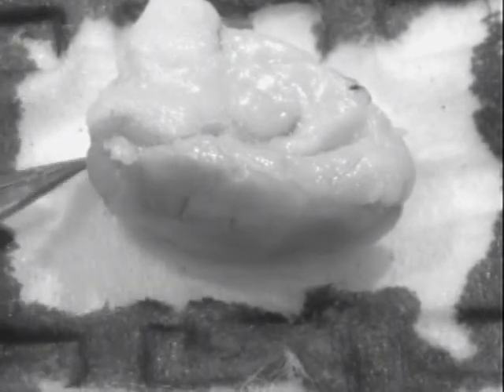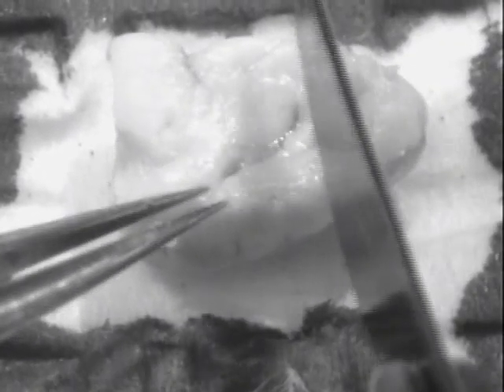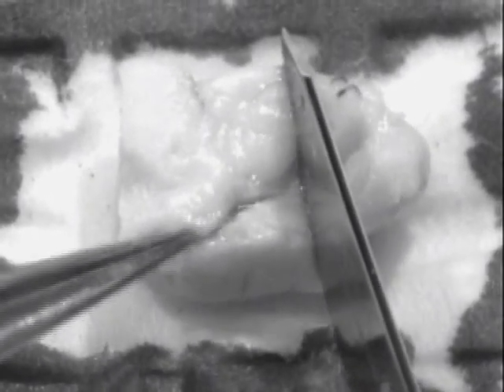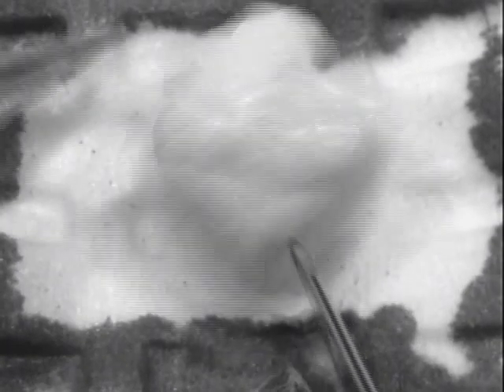What I'm going to do now is just cut the anterior portion of the brain off in front of the thalamus. I like to make this cut parallel to the cut that I made when cutting the cerebellum off. What this does is it creates a nice flat surface that I'm going to place the brain on.